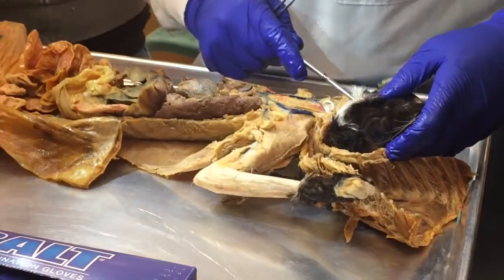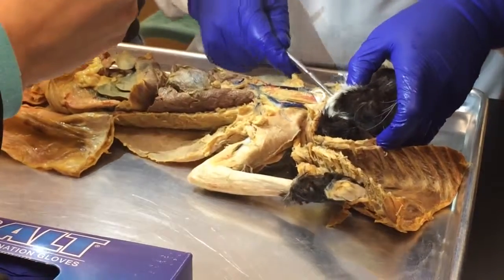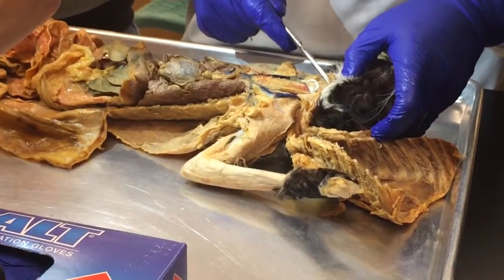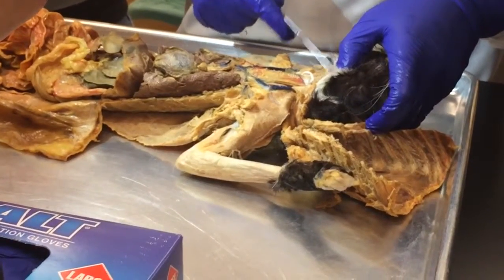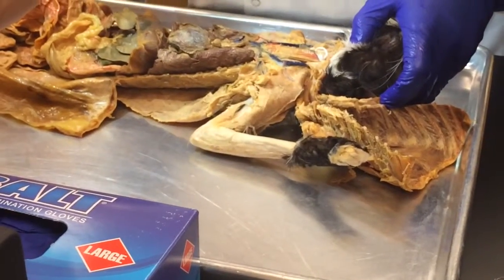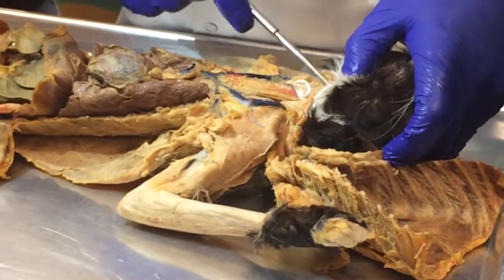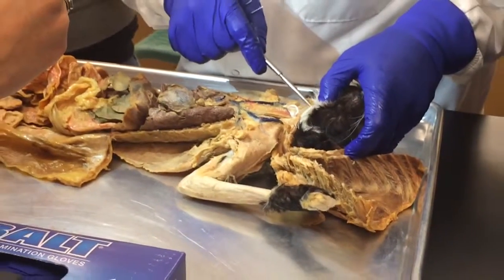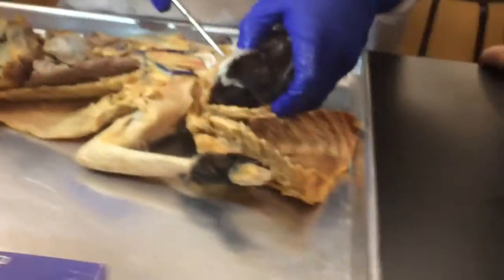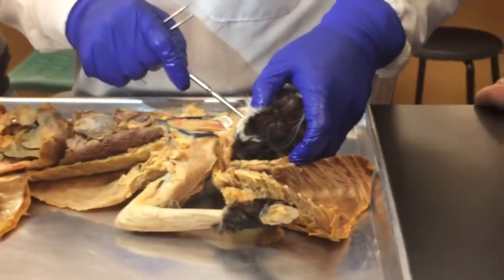I think I mangled it when I was opening. It's right on top of the larynx, right here. You see the larynx? You see the cricoid cartilage, and this kind of hard, and these are the rings that keep it open, the cartilage rings, and that's what's listed on that thingy. That's the thyroid cartilage? Yeah, the thyroid cartilage, because the thyroid gland is named, is right here over the larynx. You see what I'm saying? The thyroid is right here over the larynx.